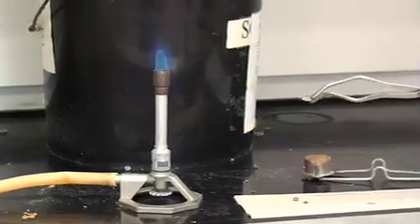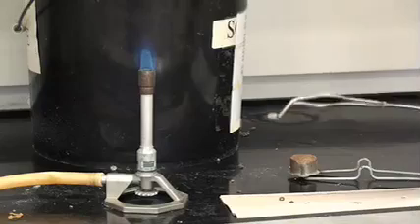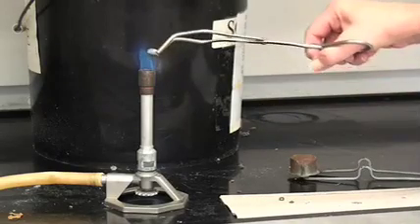Now, the surface of the metal is very gray in appearance and what we want to be able to observe is how quickly it turns white.